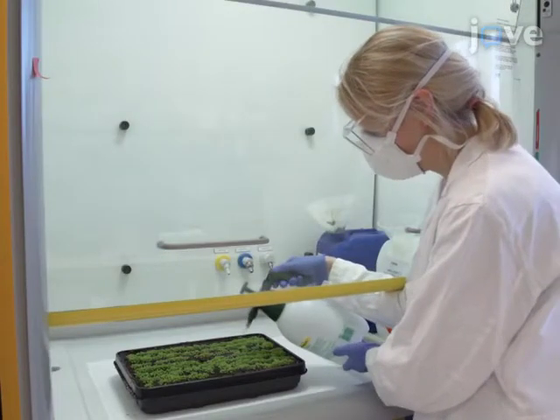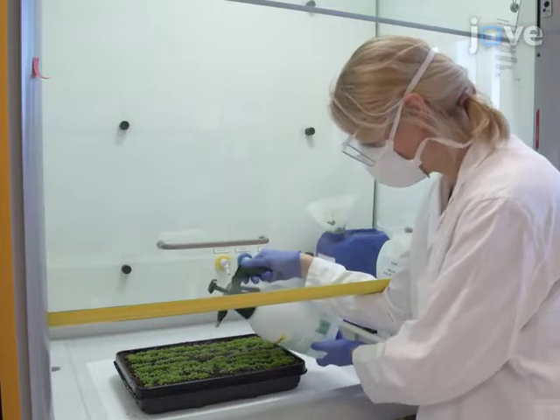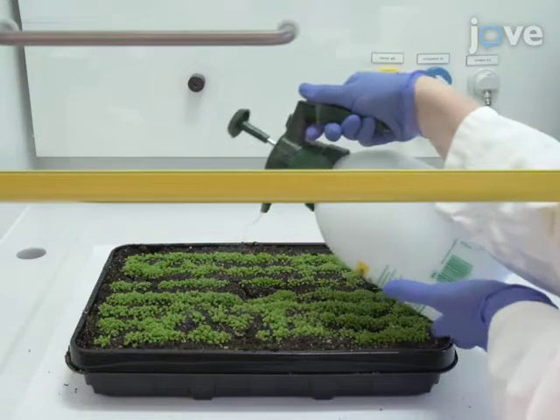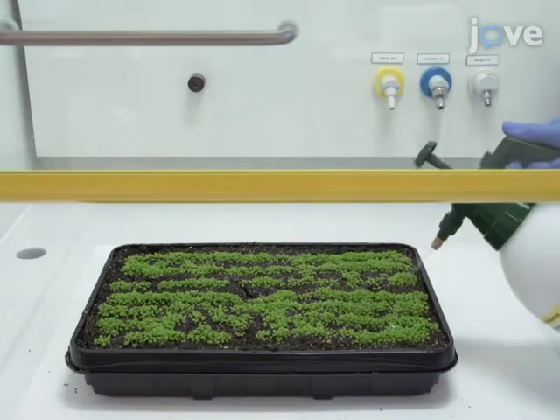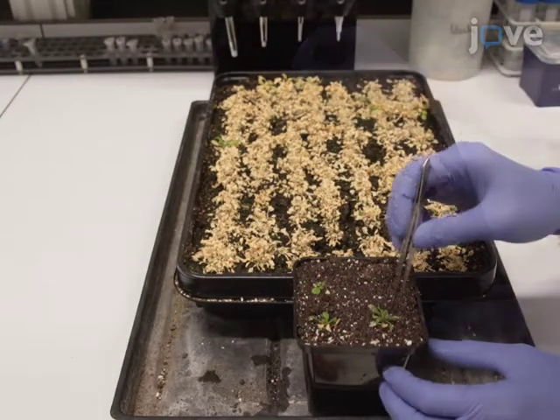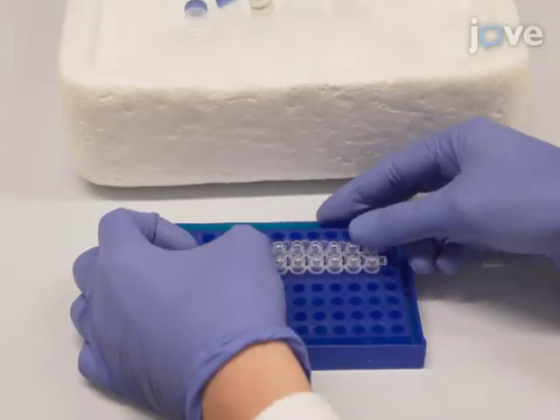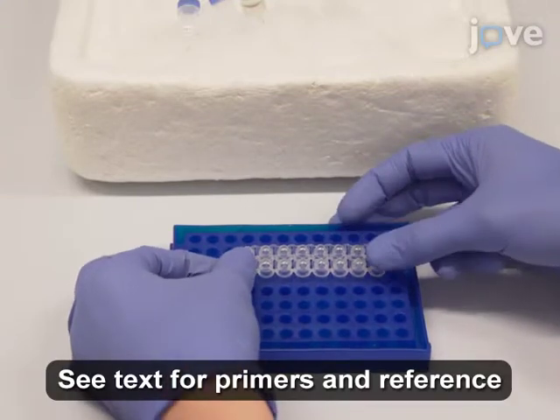2 and 3 weeks after sowing the seeds, spray the seedlings with 0.5% glufosinate ammonium solution. Use 500 milliliters of glufosinate ammonium solution per 1 square meter. Transfer surviving seedlings to pots. Analyze the glufosinate ammonium-resistant plants by PCR for the presence of the construct of interest.